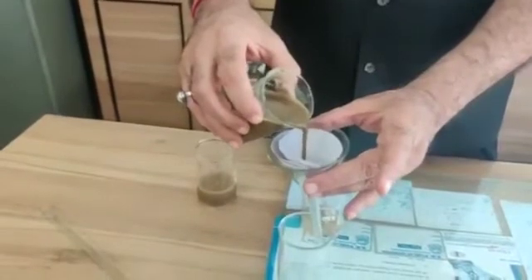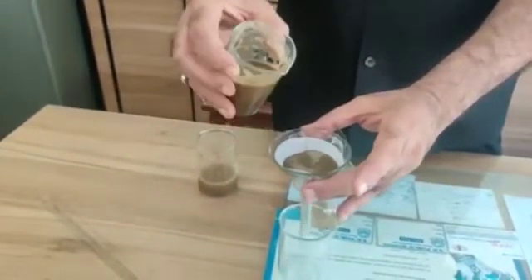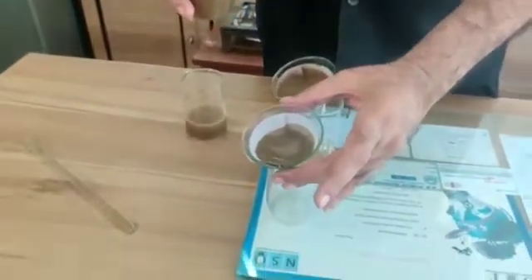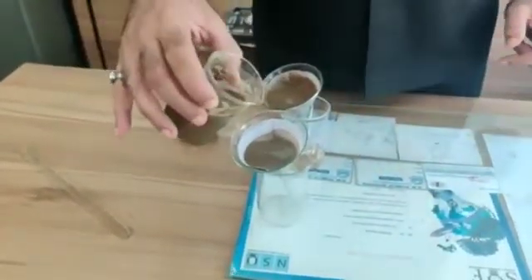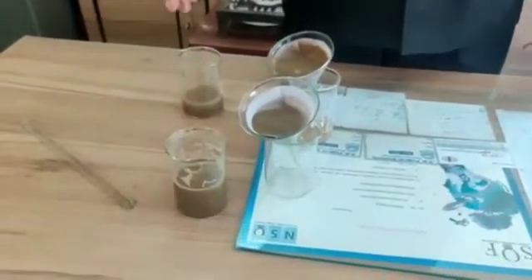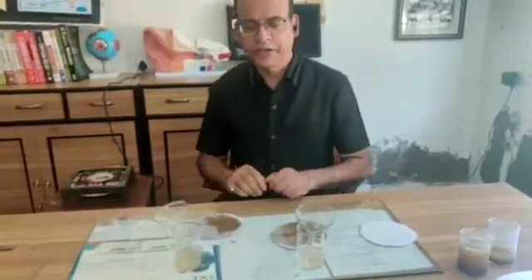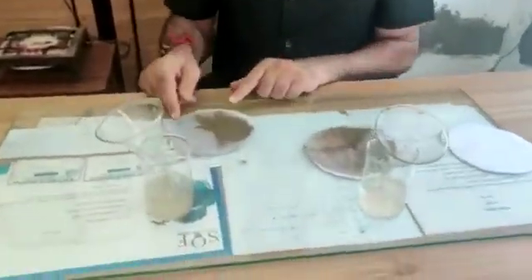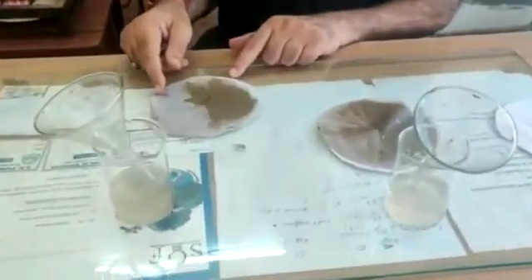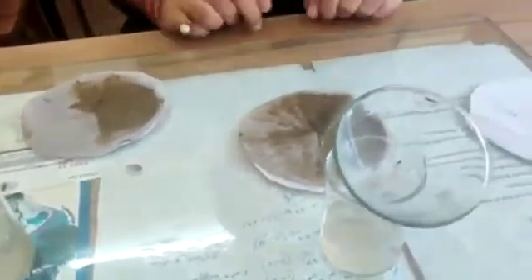Step by step we have to add the entire water into the funnel having filter paper B. Now filter paper A is in its respective funnel, and this is filter paper B having soil from water sample B.